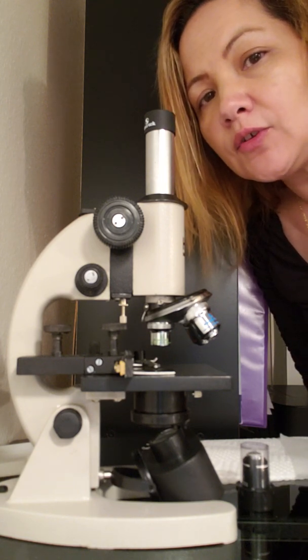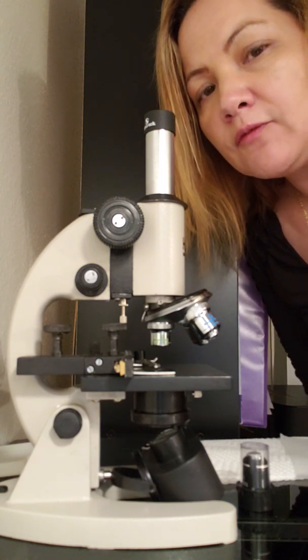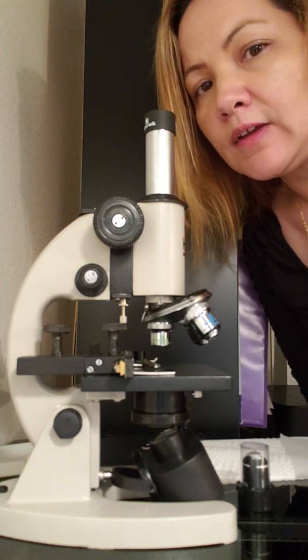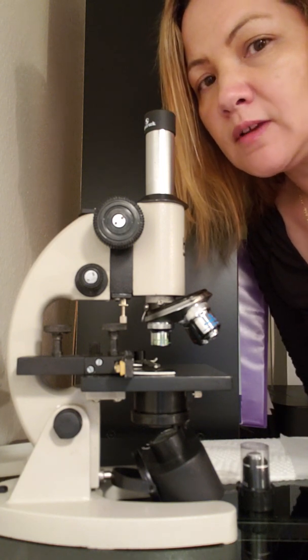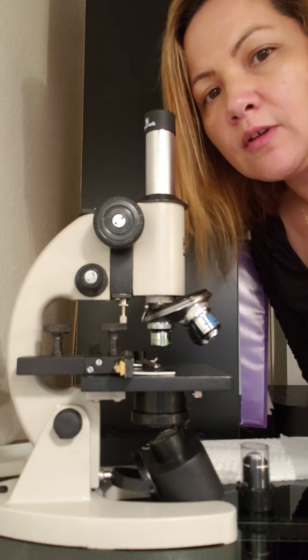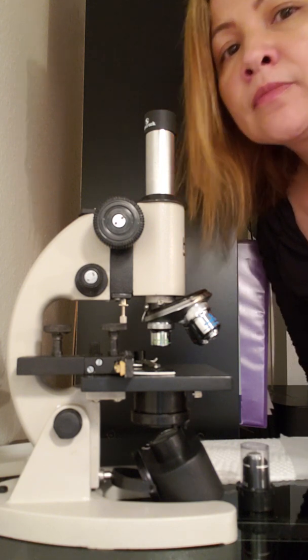It's about 12:25 on June 3rd, and I'm going to be discussing the microscopy of microbiology, the use and function of the microscope, along with 2 other items. I'm going to do this as quickly as possible, so I'm not going to do every single step. I'm just going to do the basic minimum because it will be time consuming for 3 exercises.